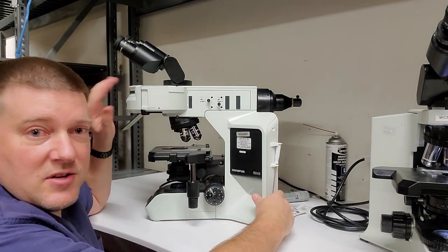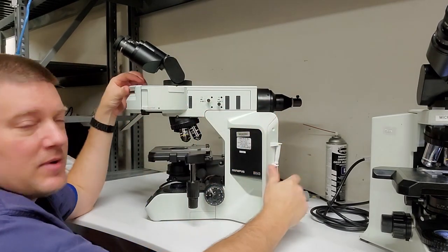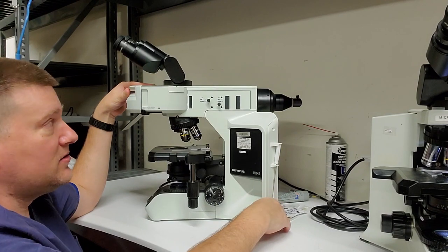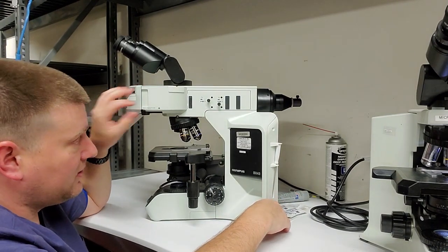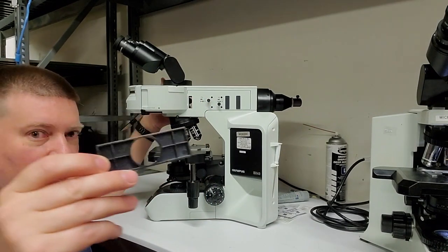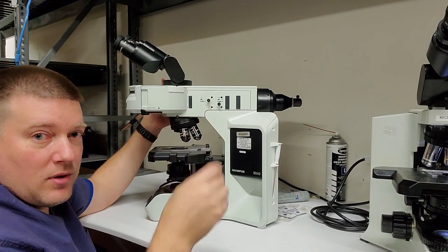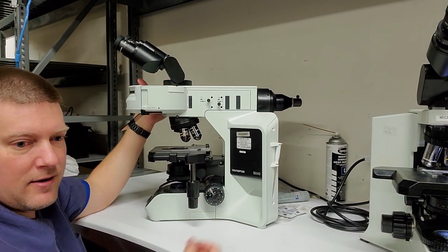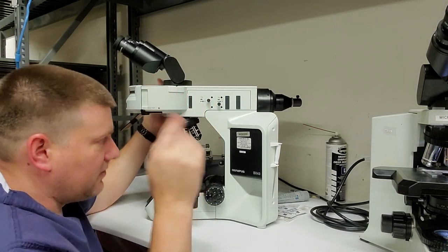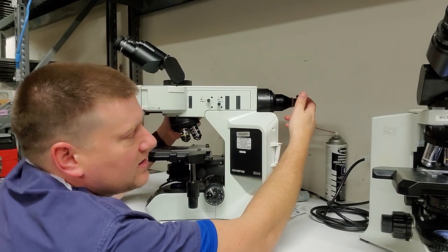So the difference in this microscope versus that one over there is this big old honking thing up here, and I'm not even going to pretend to know what every single little feature does. I know that there's different filters, there's different shutters. You can see that this is on bright field, but sometimes this one here will have a little ring in it, and that will set you up for dark field and for phase contrast. Sometimes they can do different things like that, but anyway, the important thing of this is in the very back.